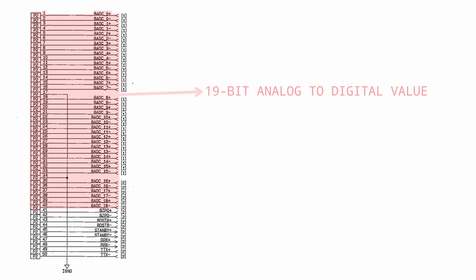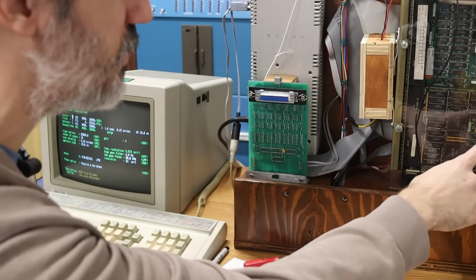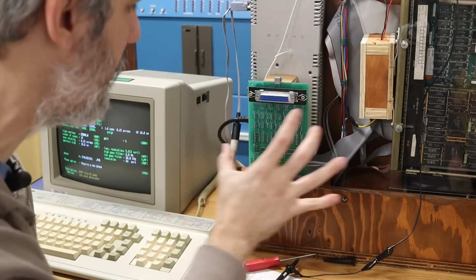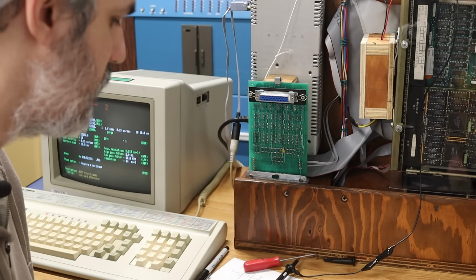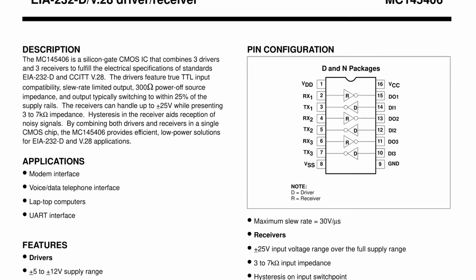All right, I keep going on about serial communication, and that's because even though we have that massive 50-pin cable that's connecting the spectrometer to the PDP-11, the bulk of that is just the ADC value coming back. There's a little extra information like ZPD and things like that, but most of the control and communication going on between the two is happening via RS-232 serial. The RS-232 that's coming out of the PDP-11 is coming into the opto-isolator board and going into an IC that is an MC145406. This is an RS-232 driver receiver chip.